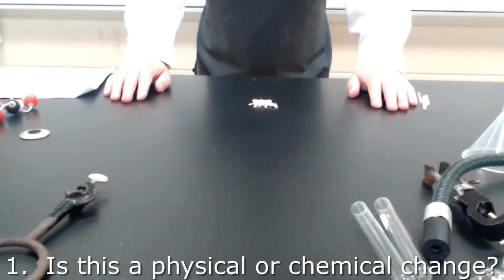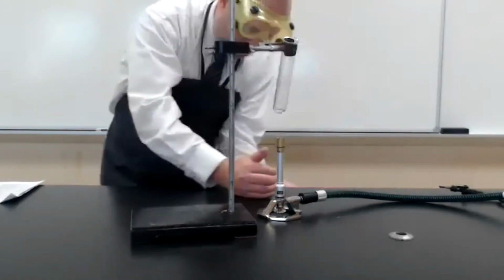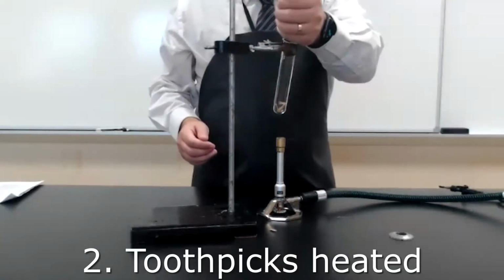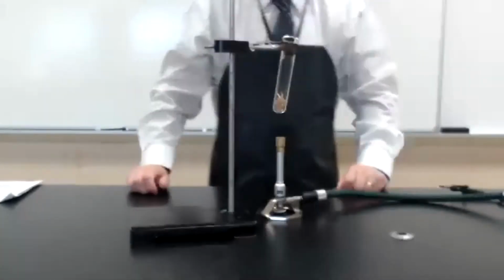Is that a physical change or a chemical change? Be sure to record your observations in the data table and decide what type of change you believe this is. Okay, for the next part, we're going to transfer these small broken up toothpicks into this large test tube. Hopefully you can do that a little cleaner than I can.